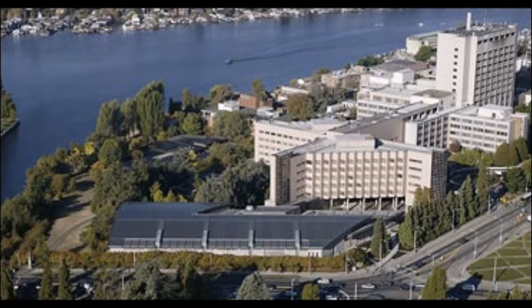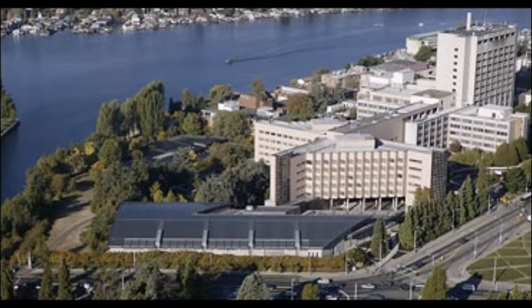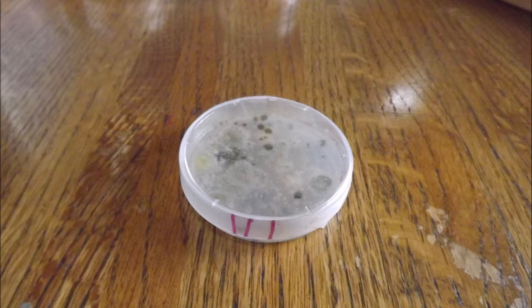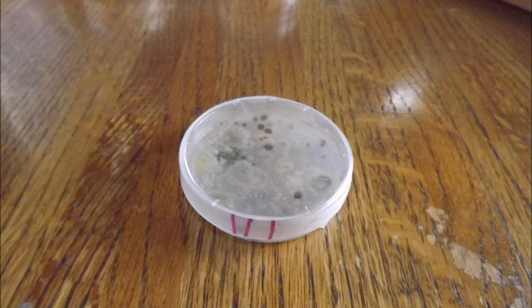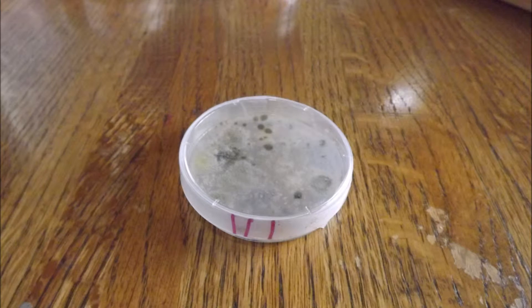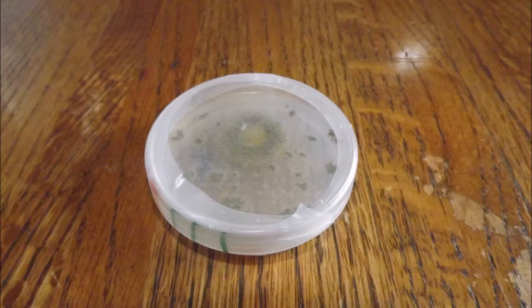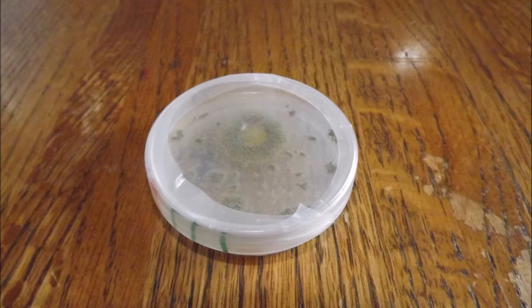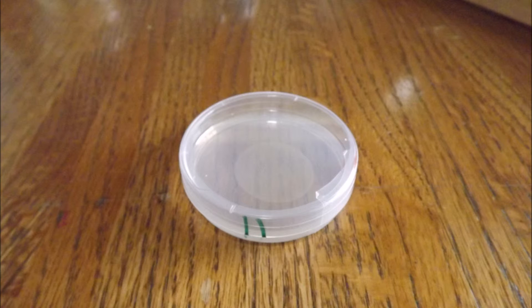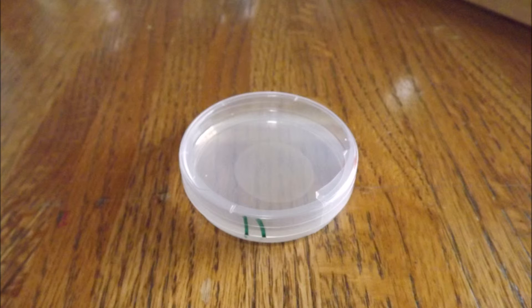To compromise, my mentor allowed me to bring the plates home as long as they were kept at room temperature. Having time for two trials would be very important, as in the first few days of our first trial, many of the plates had bacterial or fungal growth. This type of growth requires that you transfer all worms to new plates, but being inexperienced, I was not able to transfer enough worms to continue the experiment.